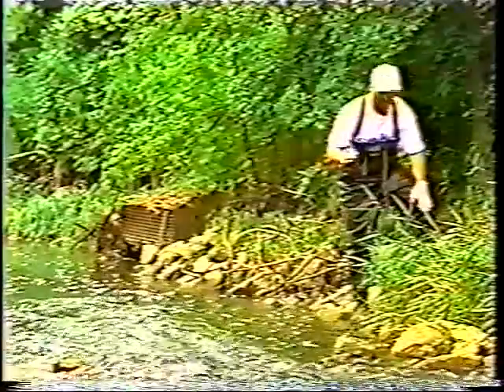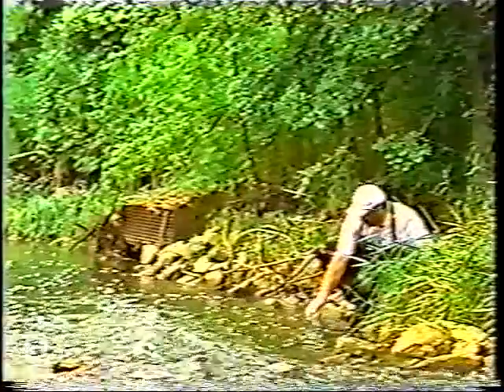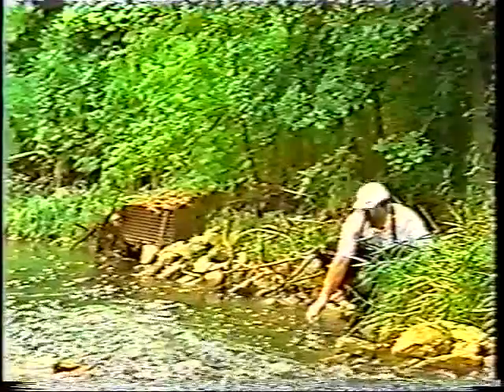I got a little quiet pool. What I'm going to do is stick the pH meter in. You want to collect the pH right at the water side because moving the water and then testing it someplace else can actually change the pH of the stream. And so what I want to do is just take my pH meter, place it in the water, and hold it there for a little bit of time.